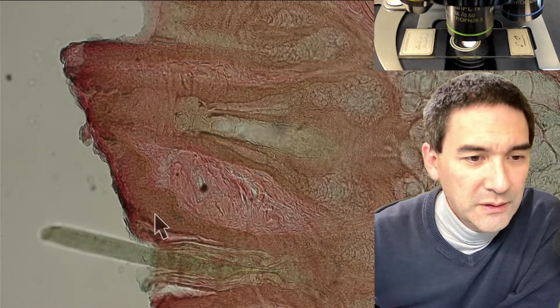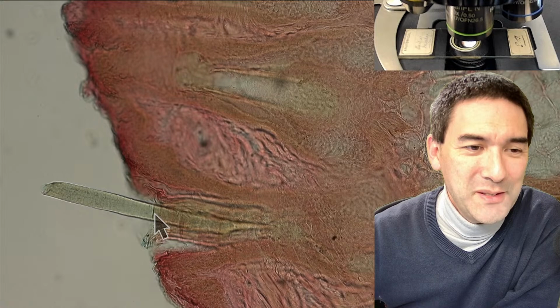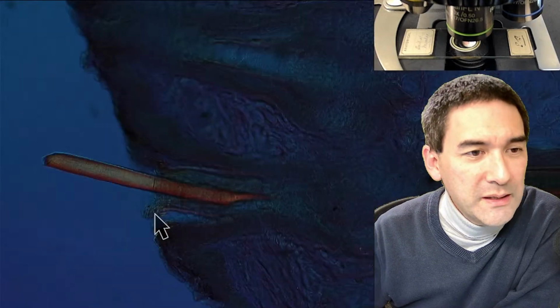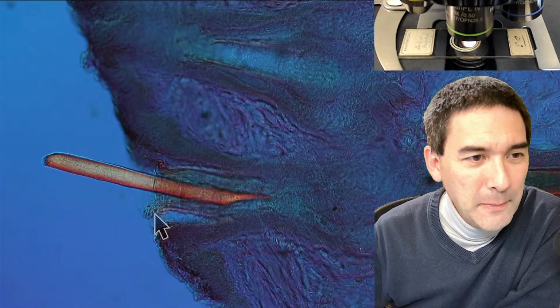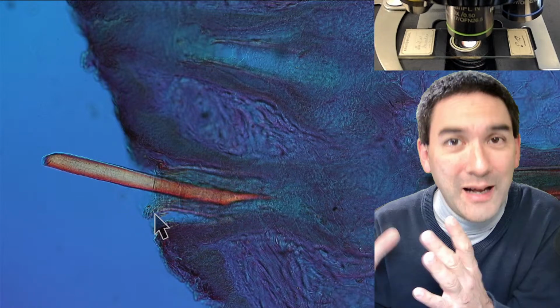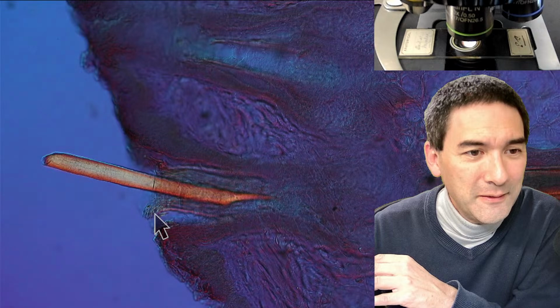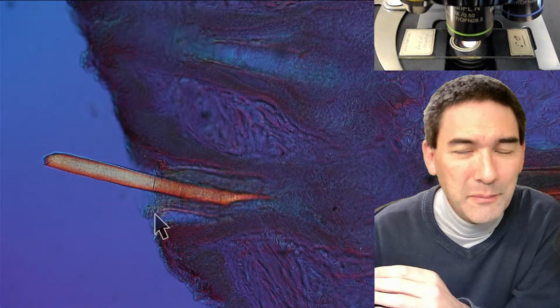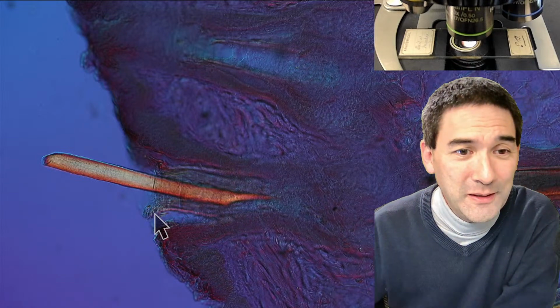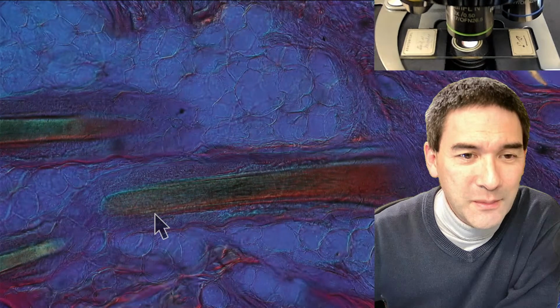When we look at it, we're able to see that it looks obviously very similar to our own hair. Let's try the following. I think if you put on polarized light, then it actually looks nicer. It's interesting that hair seems to interfere and interact with polarized light. I think this has something to do with the regular pattern of how the protein fibers are arranged, which has an effect on polarization. That's simply also something I wanted to show you here. And over here are again some more of these.